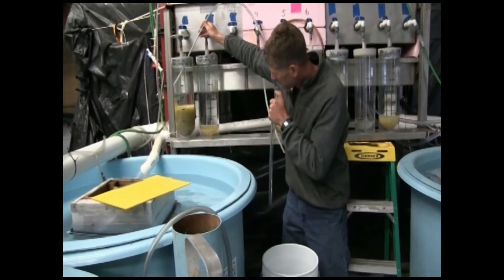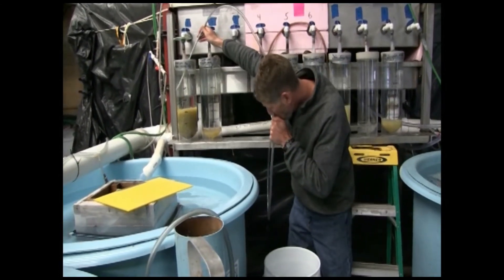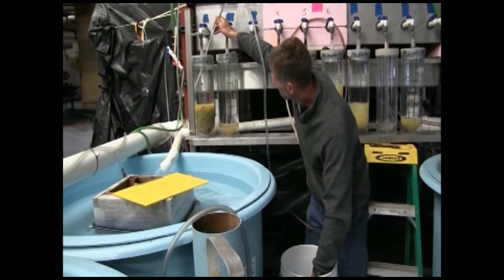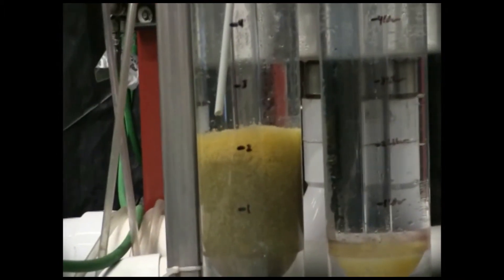A plexiglass tube, around a half inch in diameter, with a length of flexible tubing works well for this. Water flow into the bell jar should be left on during this task.